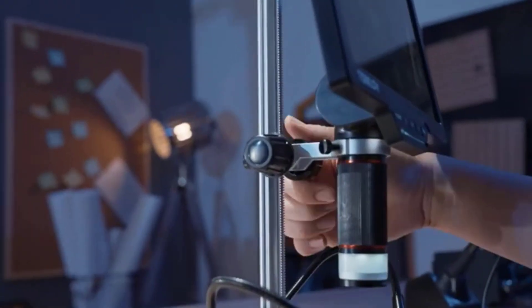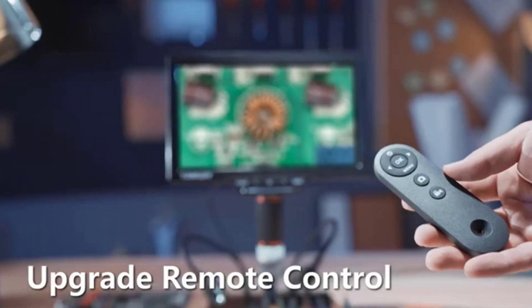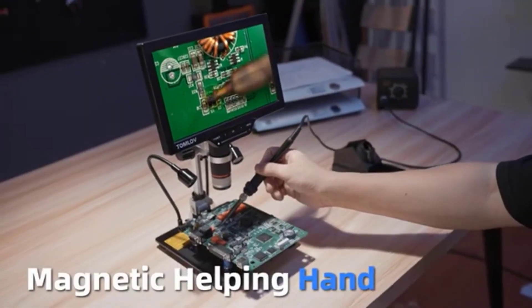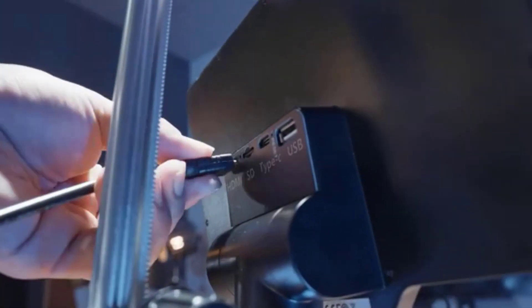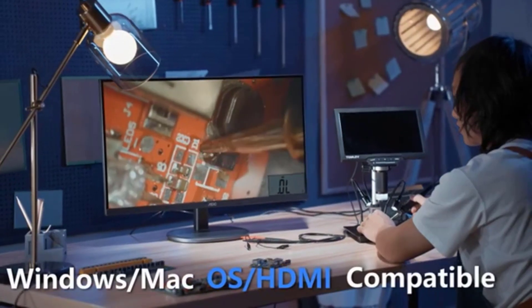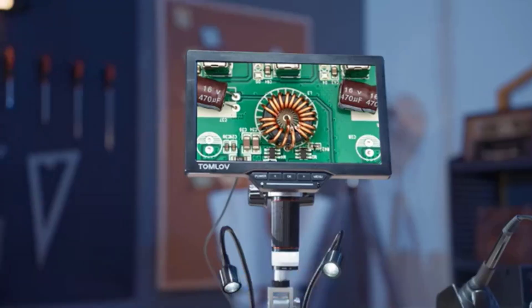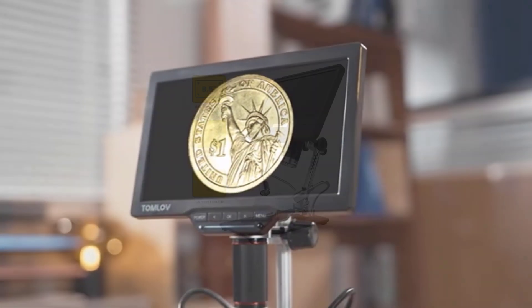With a plethora of features and functionalities, these microscopes have become indispensable tools in various fields, revolutionizing the way we perceive and interact with the unseen world around us. In this guide, we delve into the top 5 LCD digital microscopes, highlighting their exceptional capabilities and why they stand out in the realm of microscopic exploration.